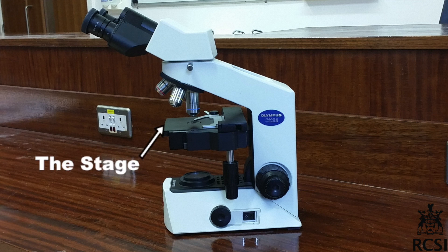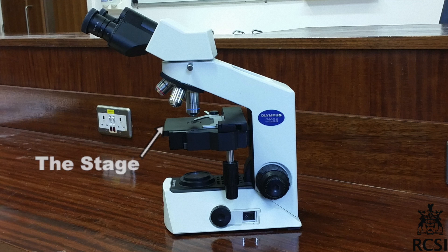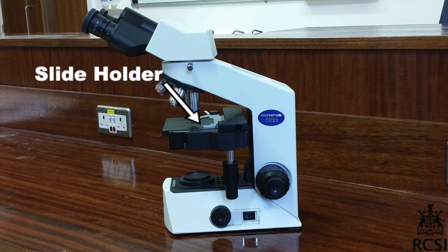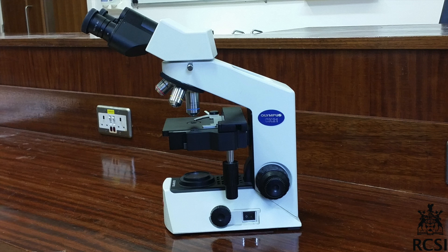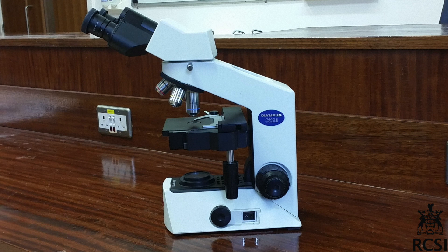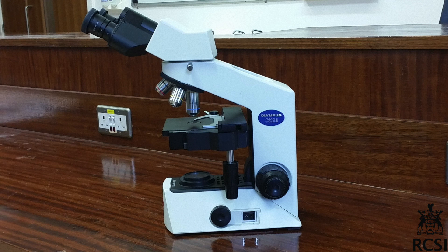The stage is where you place the slide. On the stage there is the slide holder, which is used to hold the slide in place. To move the slide holder in order to adjust the slide to the right position, we use the slide holder Y-axis adjustment knob.